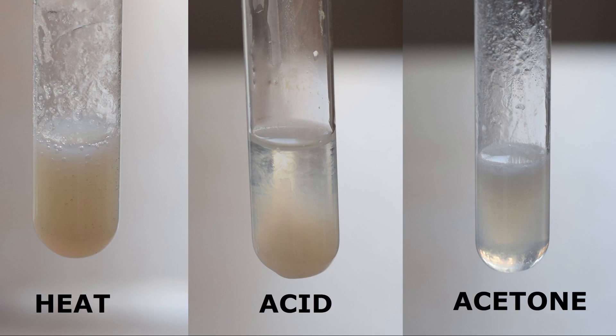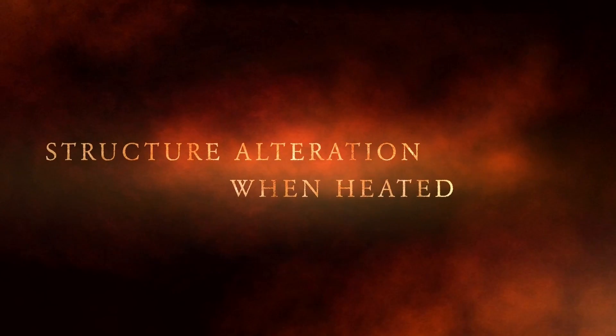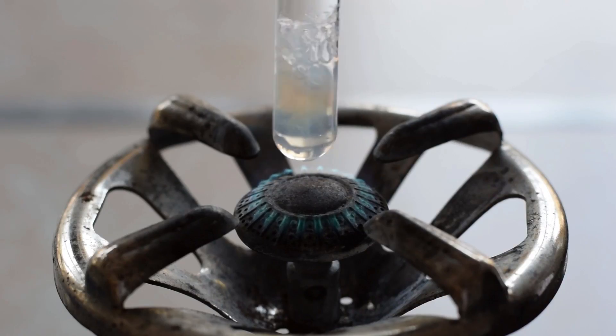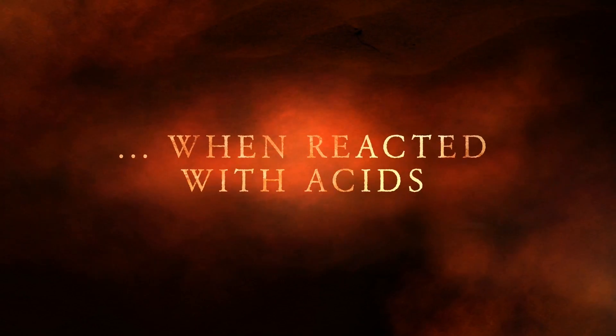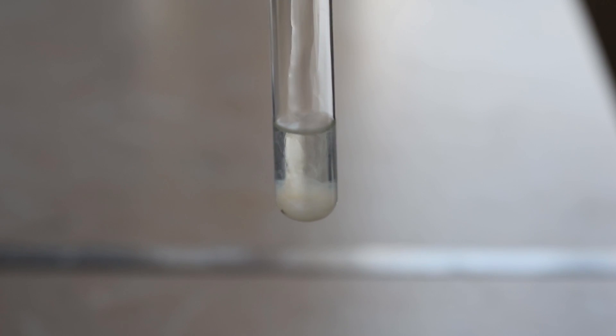Protein denaturation is an alteration process of the protein structure due to the influence of heat or chemicals.